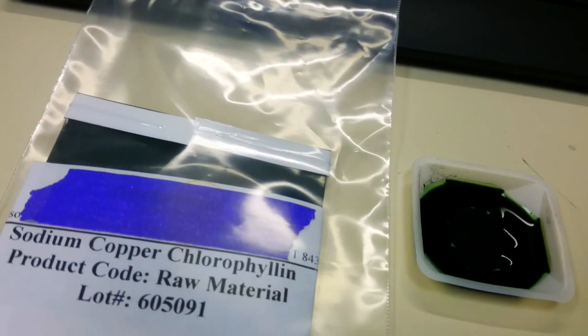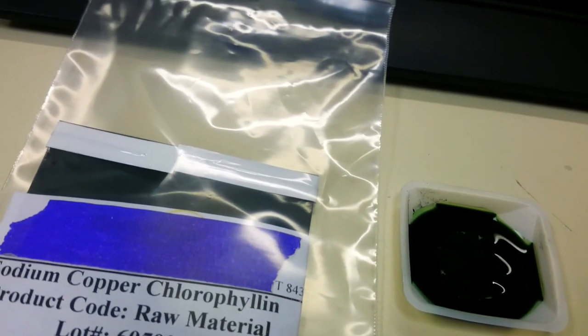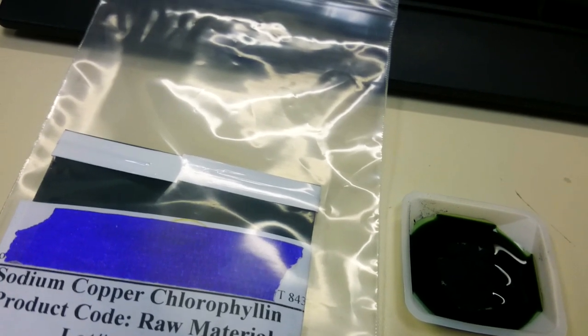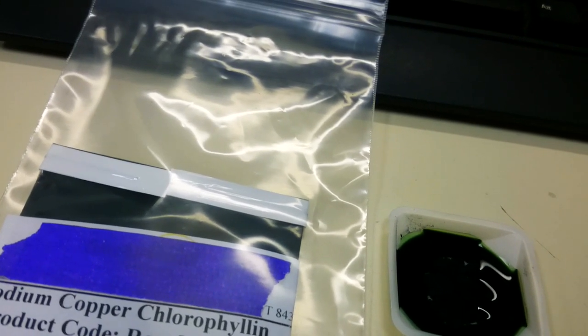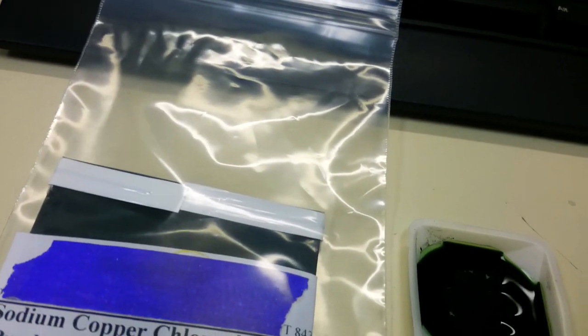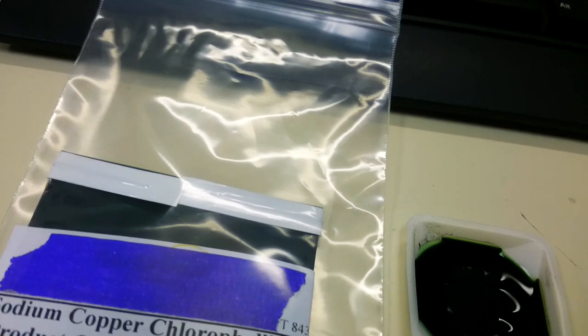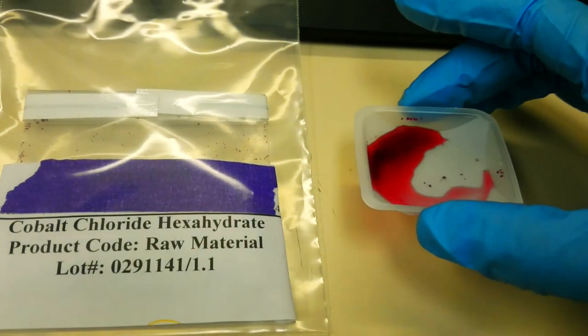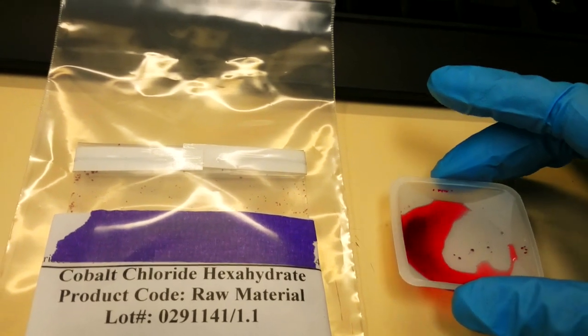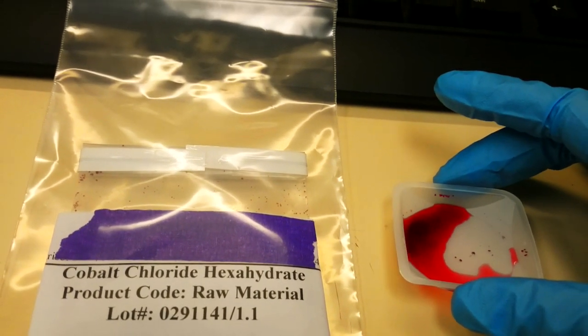Wikipedia says that chlorophyllin's sodium copper derivative is used as a food additive and in alternative medicine.